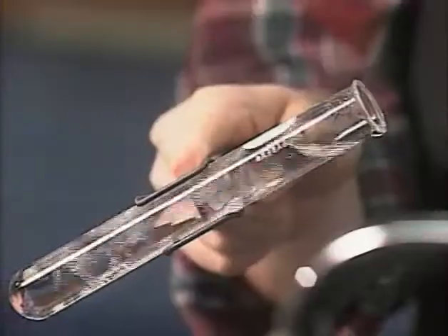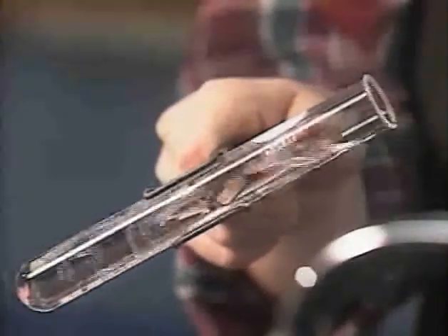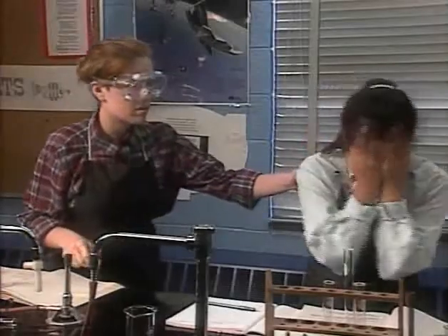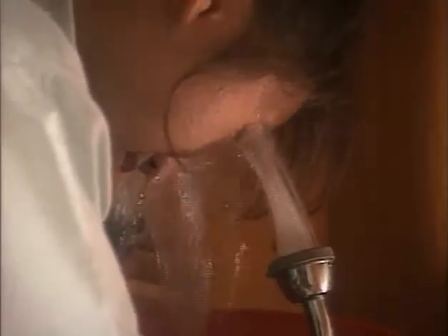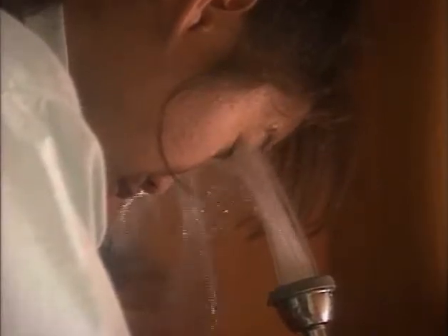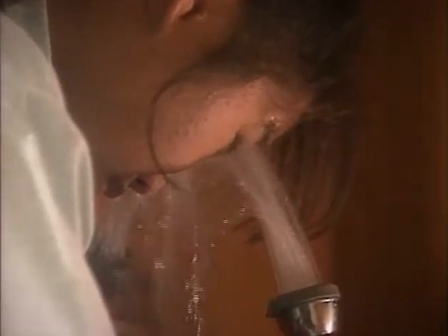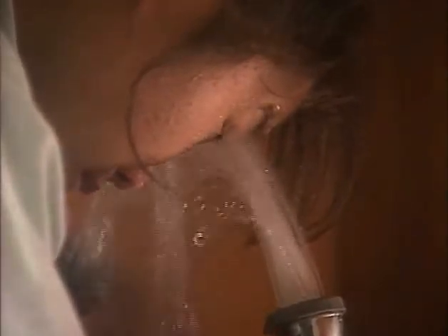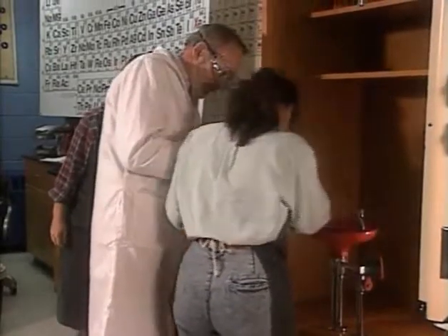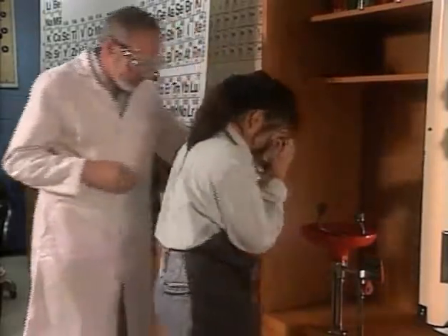Chemical spills and splashes are also common lab accidents. If a chemical hits your eyes, wash them immediately in an eye wash fountain — hold your eyes open and roll them around so the water can wash them thoroughly. If you're wearing contacts, get them out as soon as you've given your eyes a good initial rinsing. Continue washing for at least 15 minutes, then see a doctor immediately to check your eyes for damage.